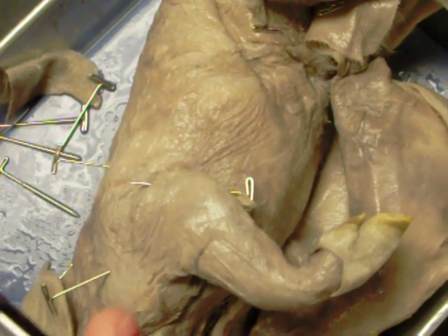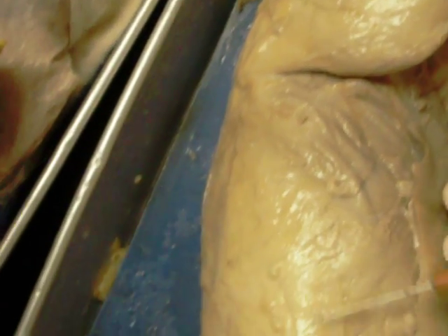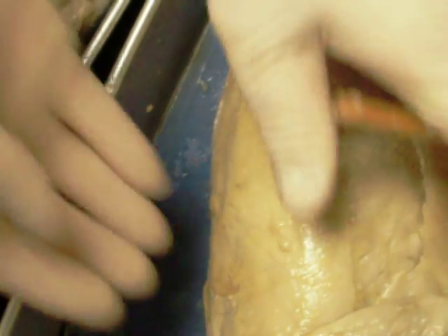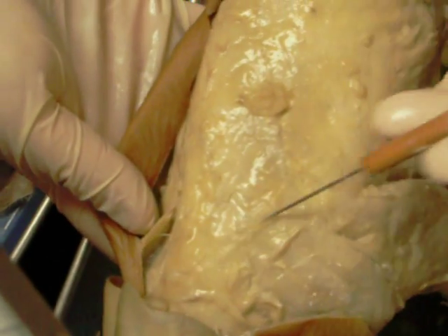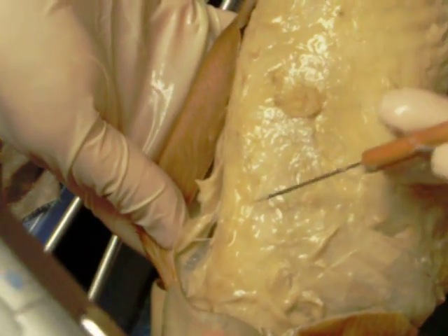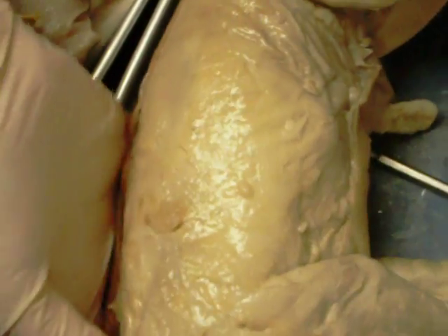We have to find the external oblique — that's the belly muscle found on the outside. Then we have latissimus dorsi right here. And then we have the trapezius, which you can kind of see forms a triangle — there's two triangles, one on each side, left and right, kind of forming a trapezoid shape. That's how that muscle got its name.